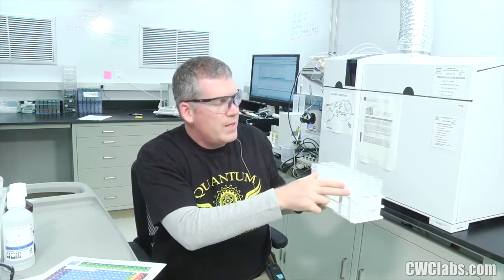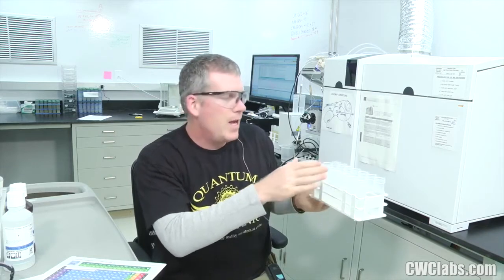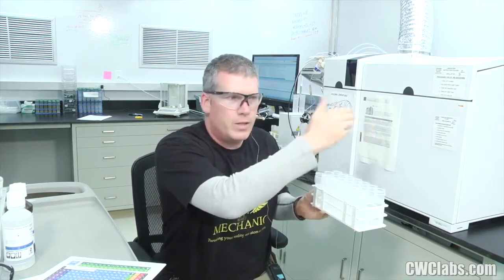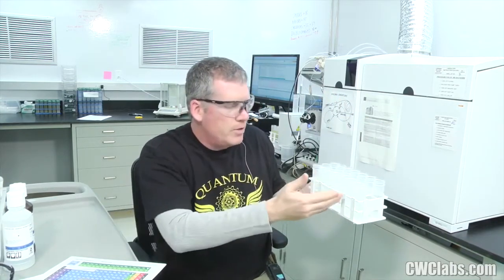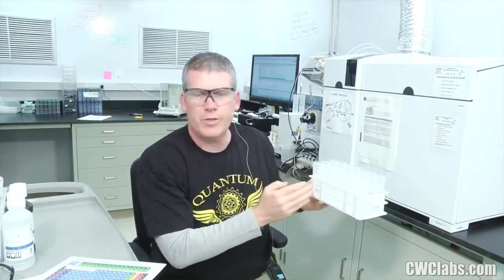But take these same solutions, make another set, and place it over in your unknown samples section. Run through the standards in your batch, get a good calibration curve, and then direct the probe to sample all those five, the same solutions as unknown samples, and see if it gives you the same results that it got in the calibration curve.